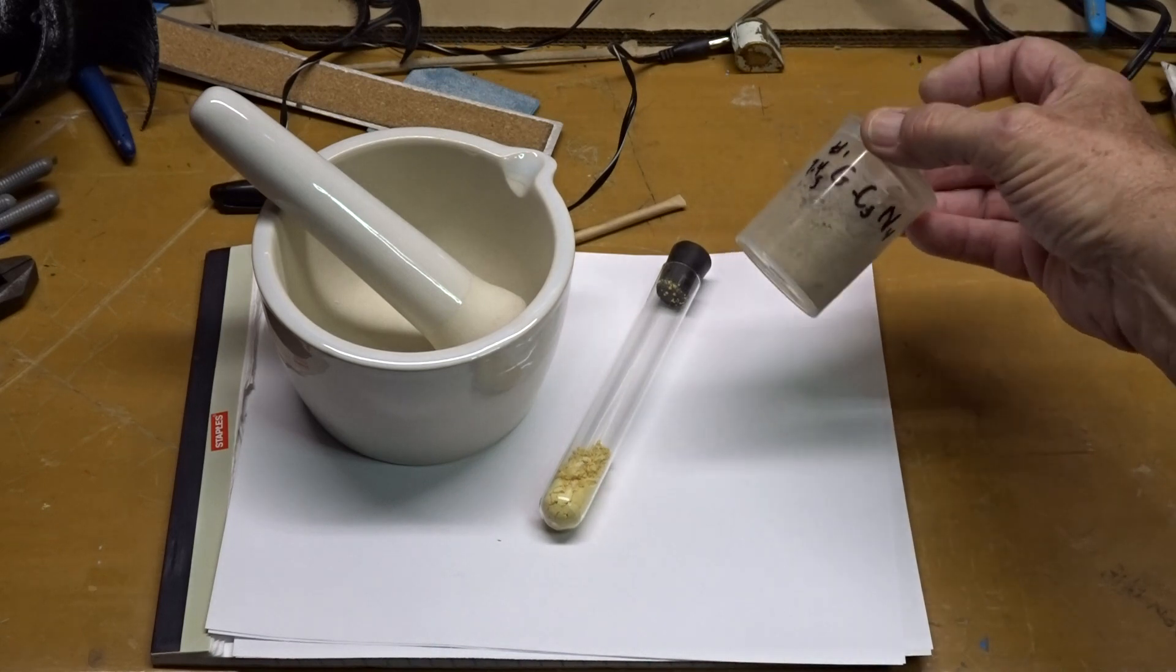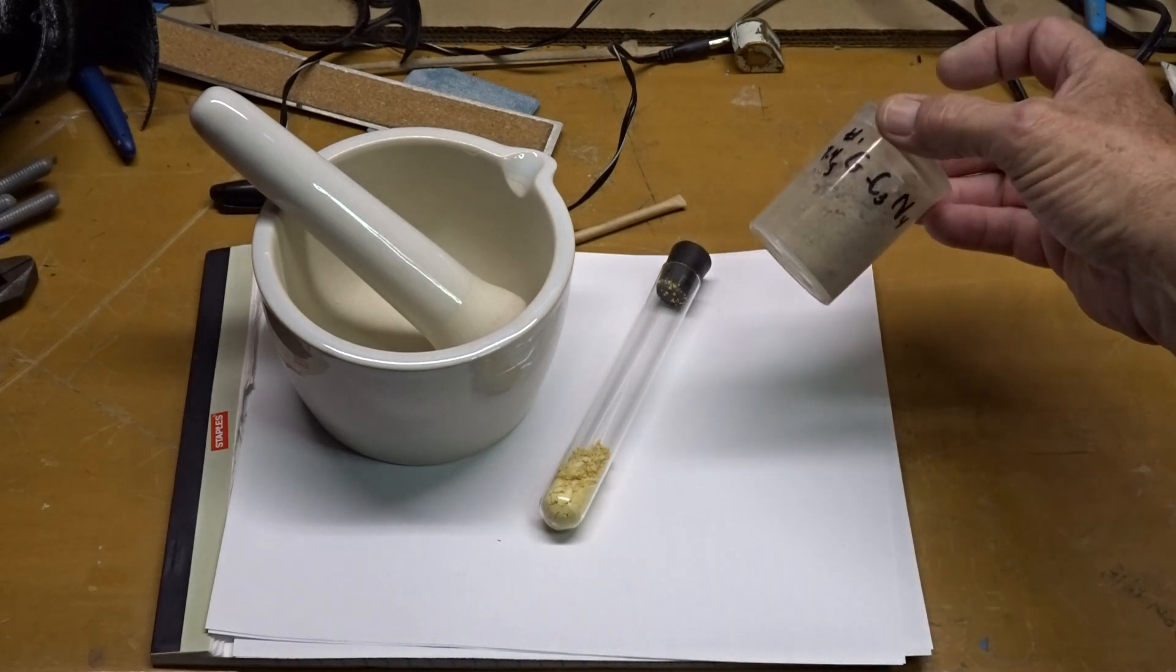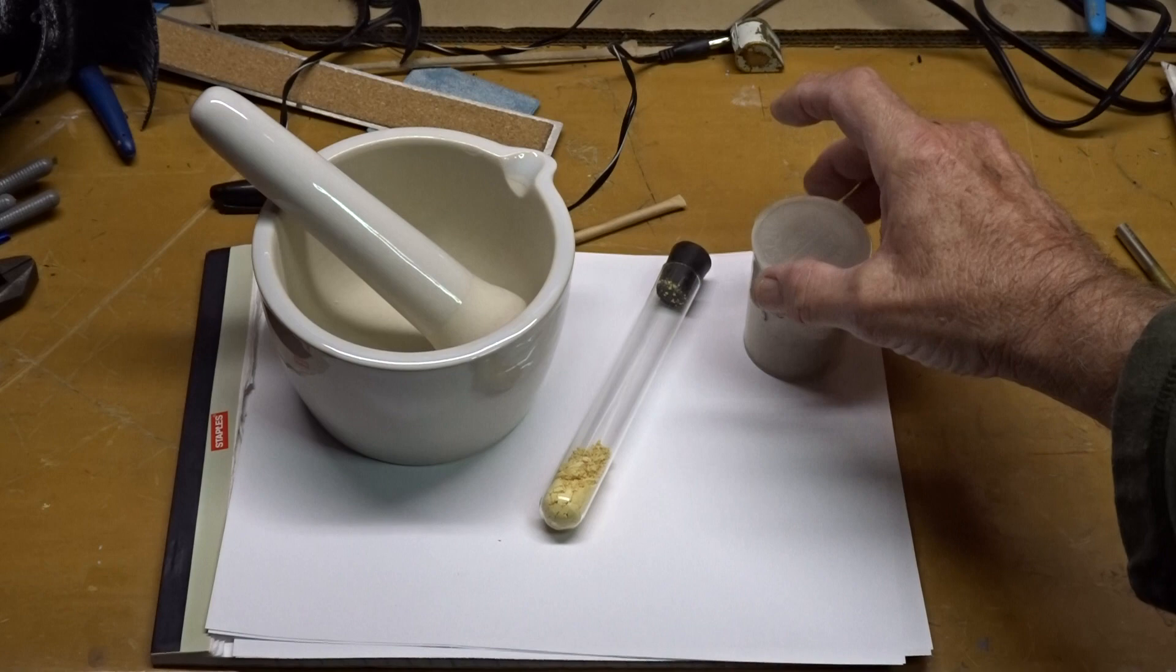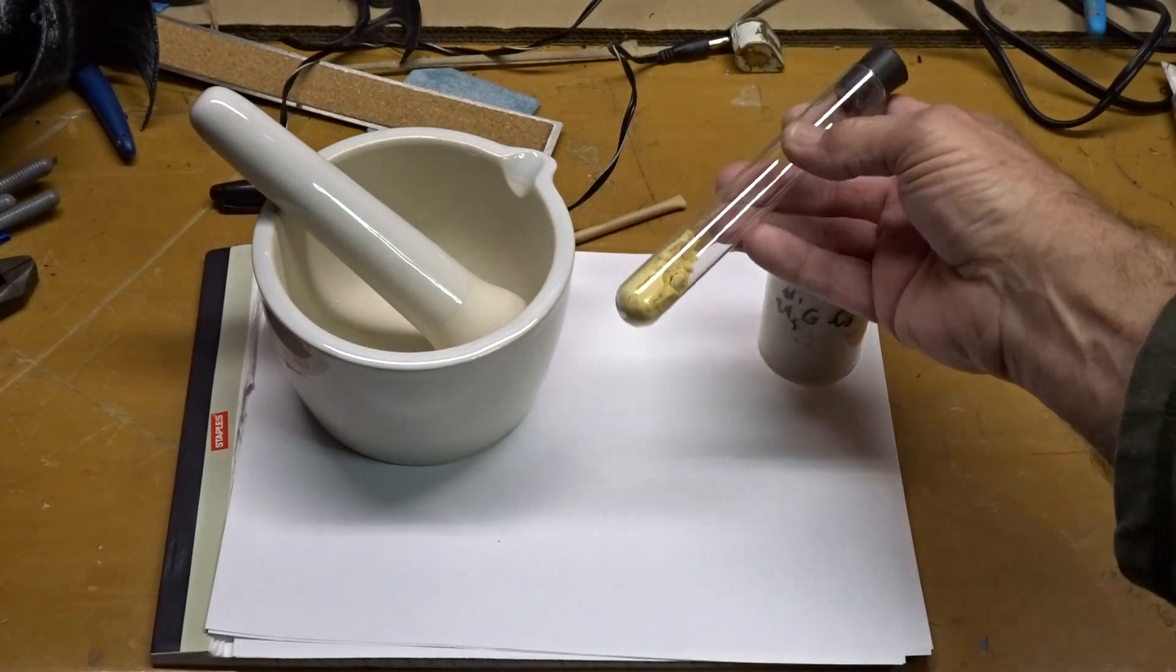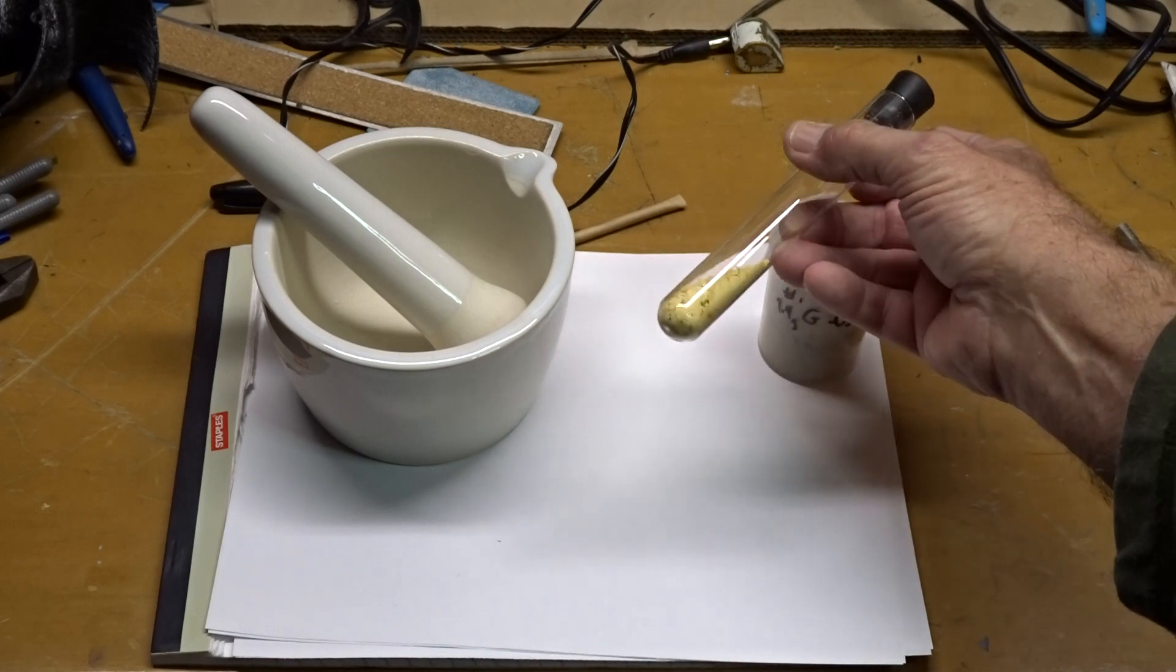I did this six times using urea of different purities with the same results. I finally switched to thiourea and it appears as though I got the desired result.